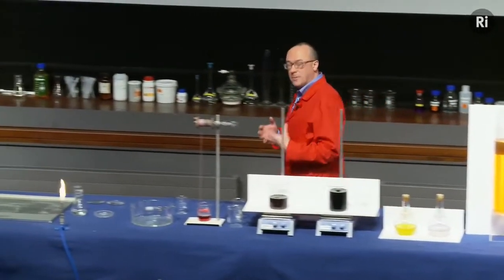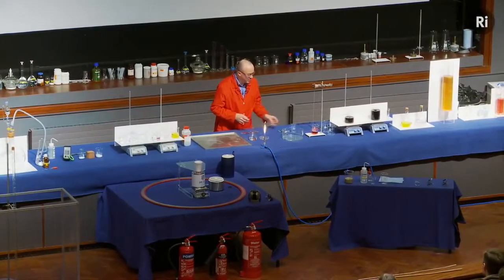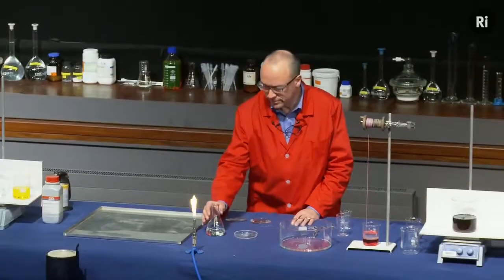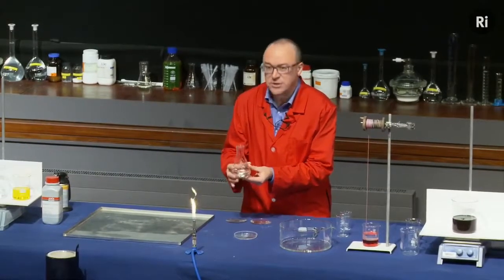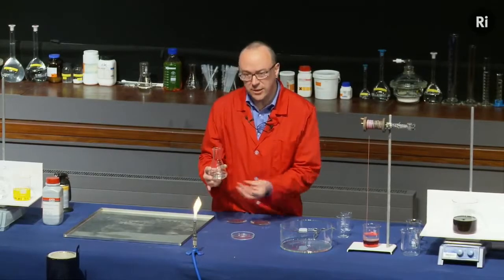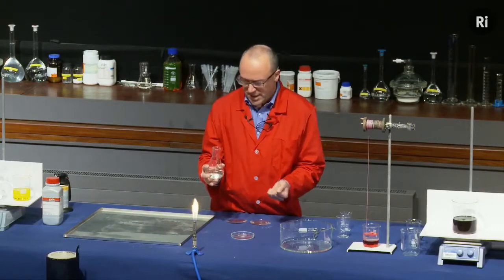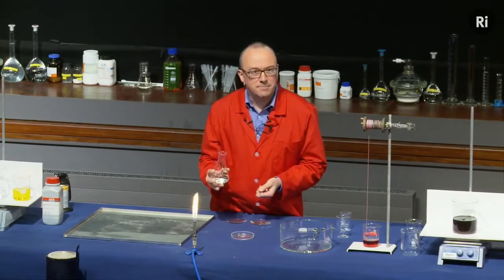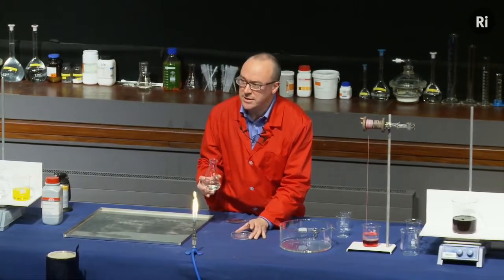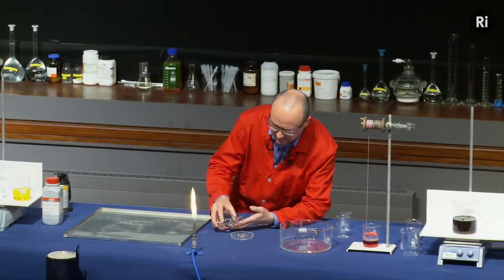Okay, so that's an example of a chemical reaction that produces a change of state. I want to show you another example of a chemical reaction. Again, this is going to go from being a liquid to being a solid. So in this flask I have a solution of sodium acetate, and this sodium acetate is a liquid, as you can see, but it would very much like to be a solid. It would like to turn into a crystal. But it needs a sort of an excuse to get going. And the excuse is going to be some little crystals of solid sodium acetate in this dish. So watch what happens as I pour the liquid onto the crystals.